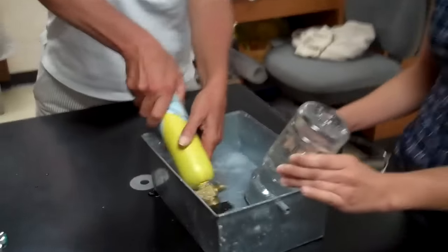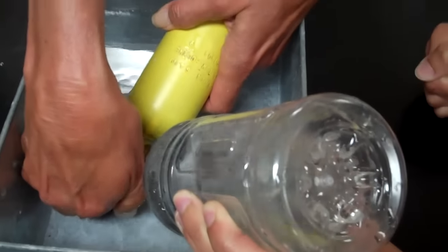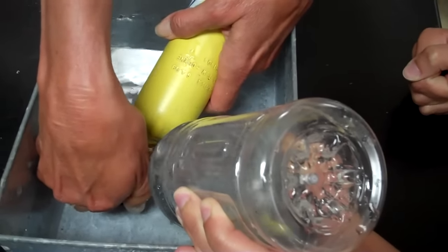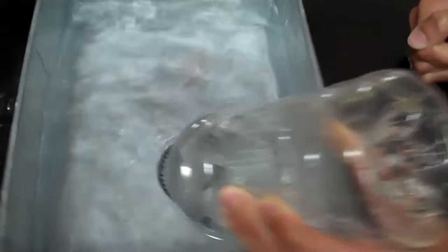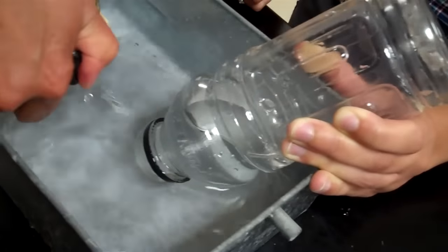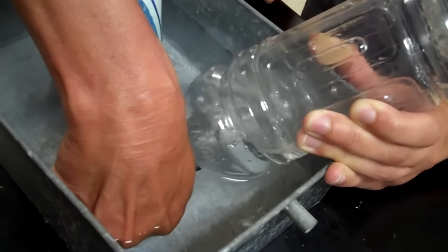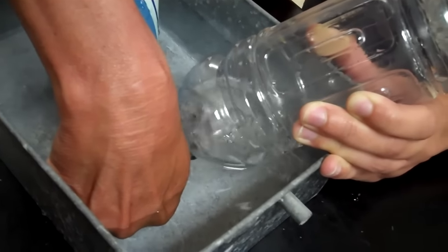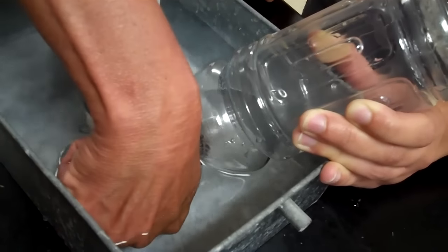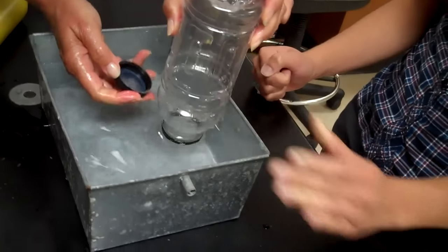Amanda, you might want to get closer so that you can see it bubble inside. This is where I would say that we wouldn't need all of this. And when it's about two-thirds full, we're going to now put in some oxygen gas. Sometimes this is really tight. Once it starts to bubble out, we know it's got enough in it. These two gases are lighter than air, so when I pick it up, we can assume the gases aren't going to fall out right away. Hold onto that.